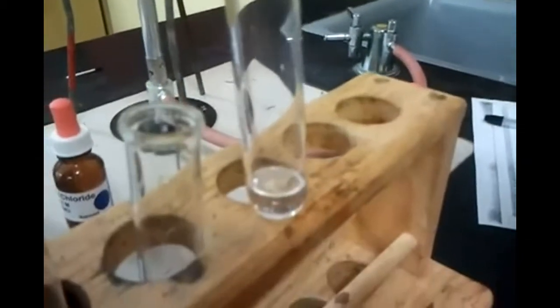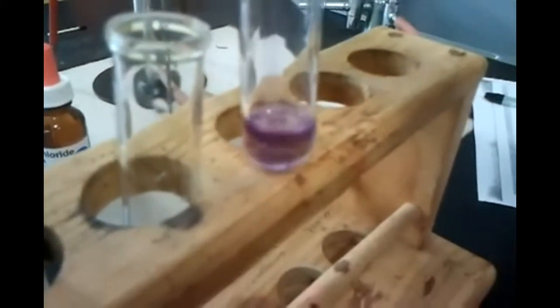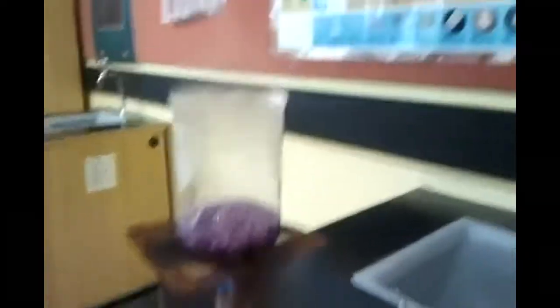This is sodium hydroxide — it's a base. It should turn pink. Oh, I'll just say purple. It's purple as well — it's got a bit of blue-ish, but it's just purple. Okay, purple.